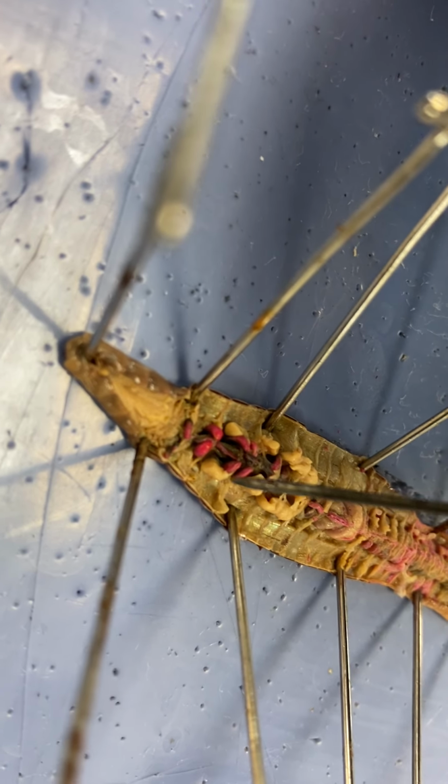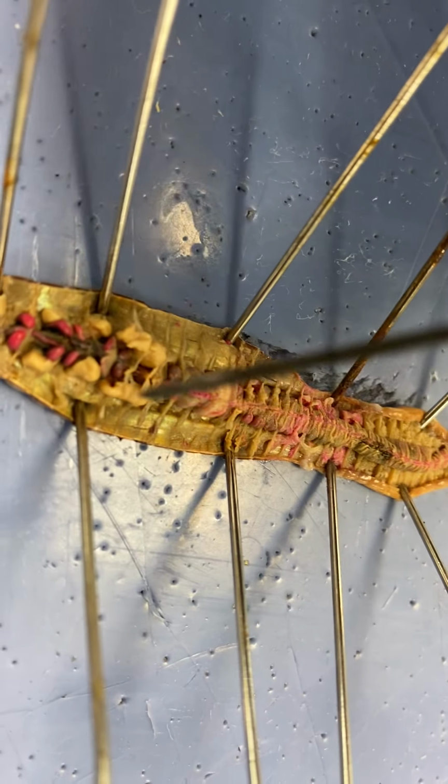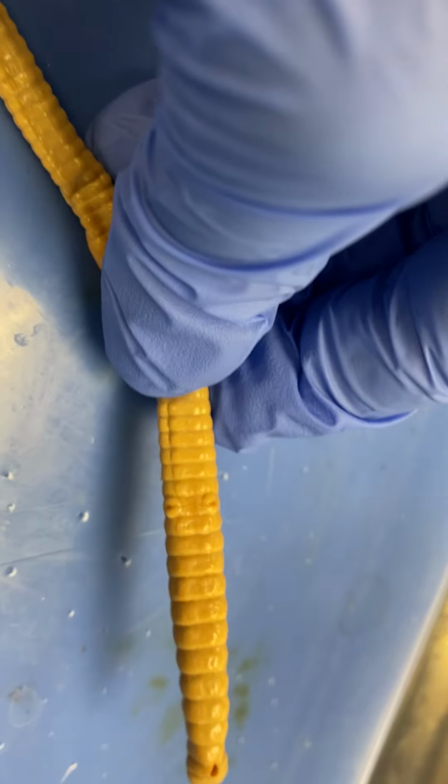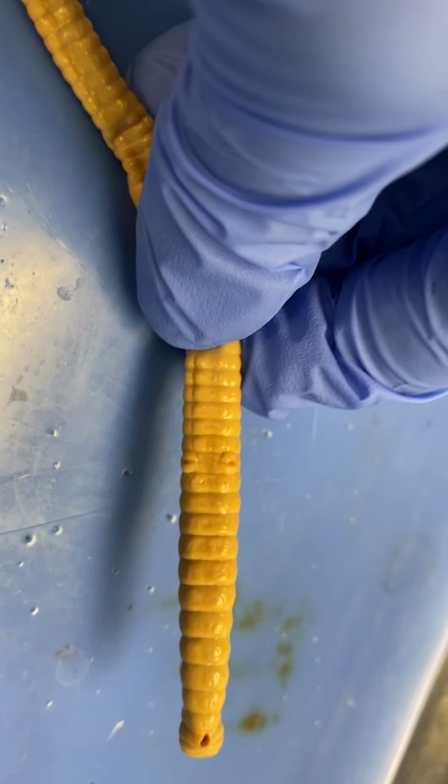They fertilize another worm. And like I said, they will attach at the clitellum. I have already cut it open, but I showed you on the other worm those two little holes, the genital pores or the sperm ducts. That is where they will transfer the sperm.